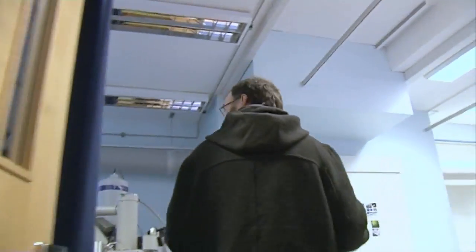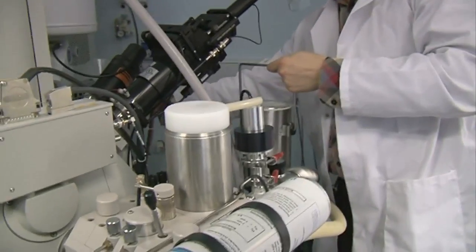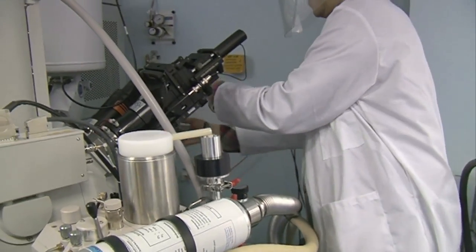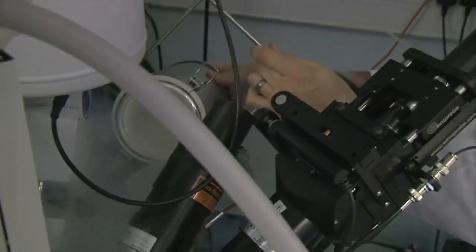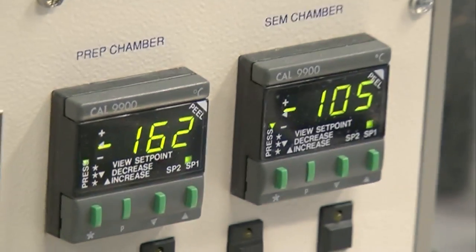What Chris is doing at the moment is he's putting liquid nitrogen in so we can actually keep the sample nice and cool so the ice doesn't melt while he's imaging it.